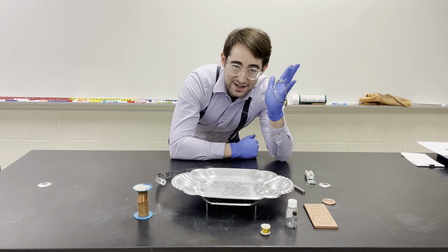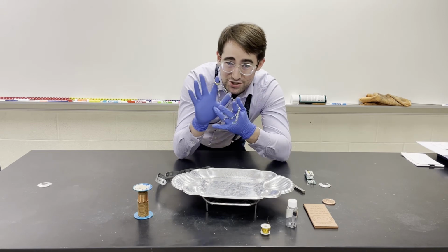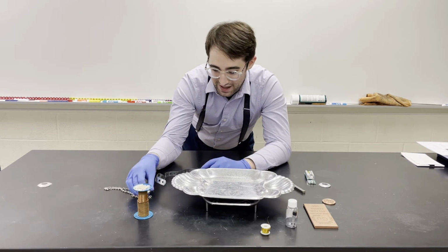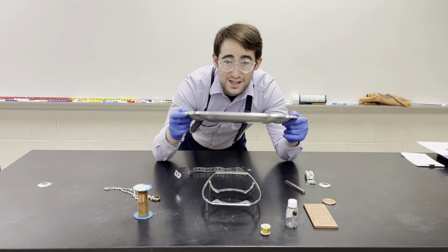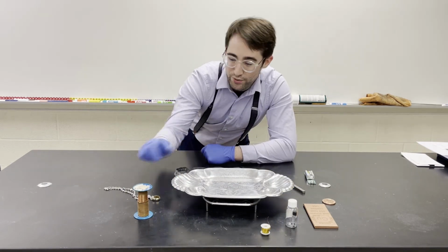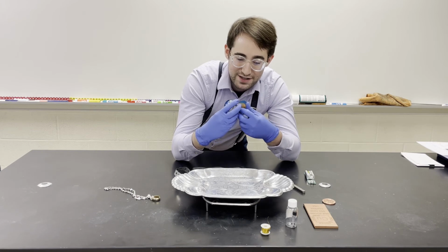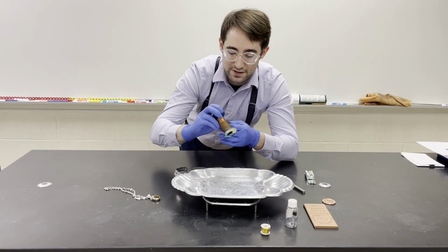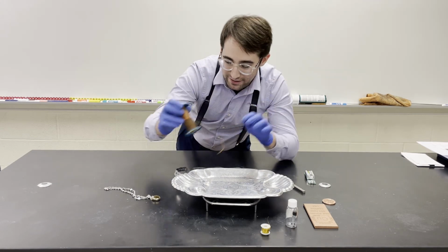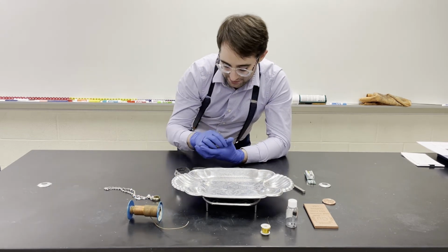The other thing that makes metal ideal for jewelry is being able to shape it into all kinds of things, like how I can have it flattened out into this here, or I can have it flattened out into this sheet here. We can have it pulled thin into wires, like what I've got here. I can unwind some of this. Okay, so if we can get something, I cut my glove.